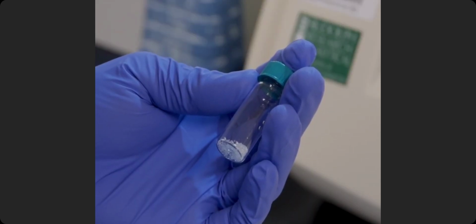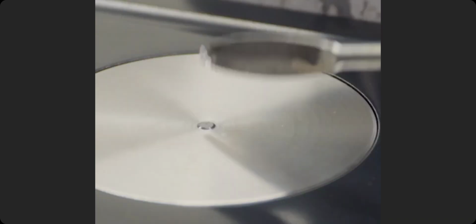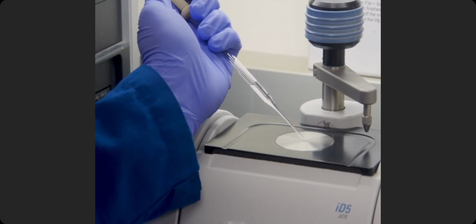Next, obtain a solid sample of an unknown organic compound and note its appearance. Using a clean metal spatula, carefully place the sample on the crystal surface. Alternatively, for liquid samples, a pipette is used to transfer samples to the crystal surface.